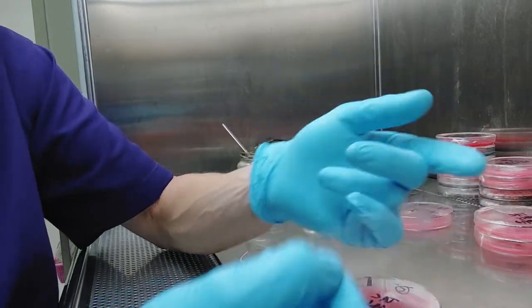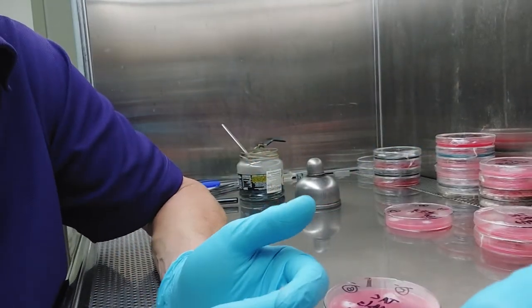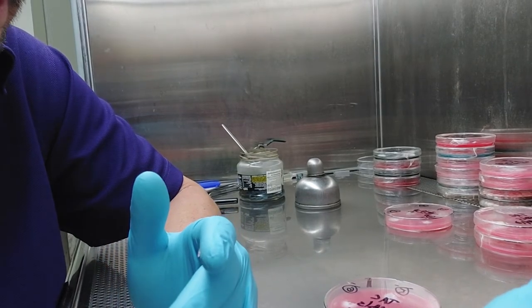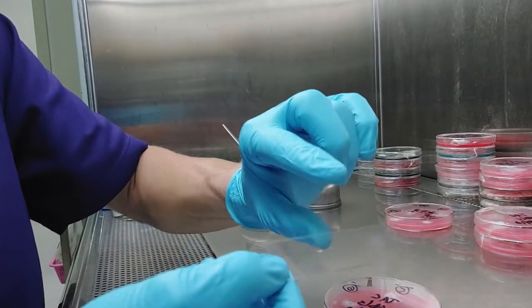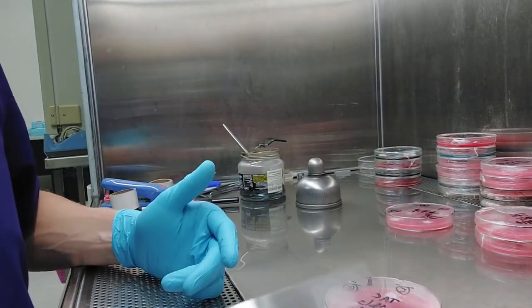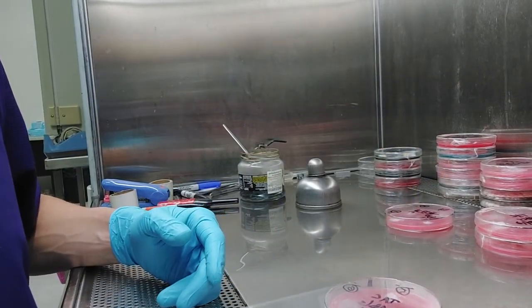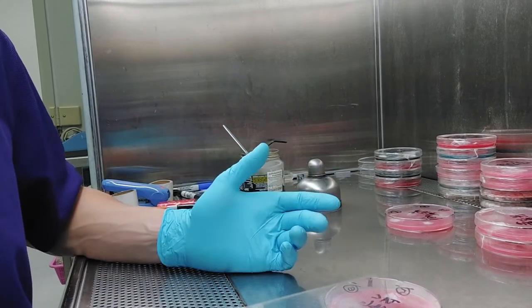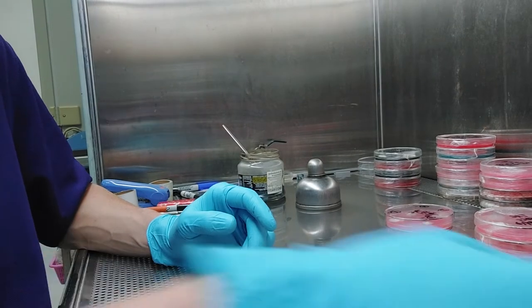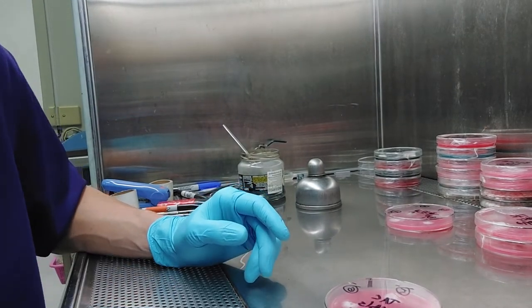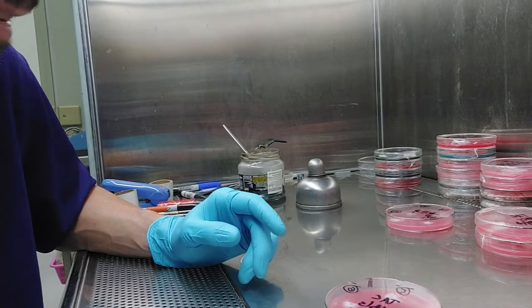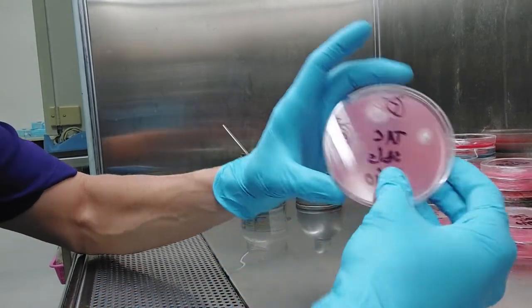And then that's where the microscope video comes in. The phone mount for the microscope is a pain in the butt. So that's where you guys are going to have to go consult another video. I'll try to make a video about how to find or not find clamps, look for clampless mycelium under the microscope. It's not the easiest thing to do when you're first starting out. It gets pretty intuitive after a while, but it makes your eyes very tired.